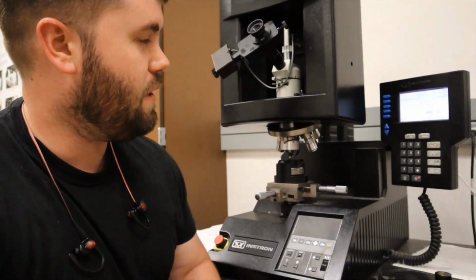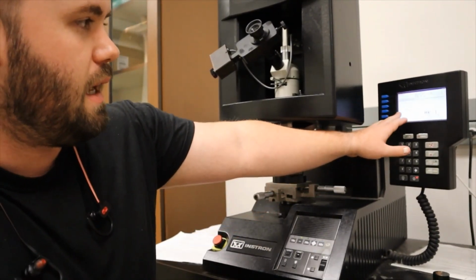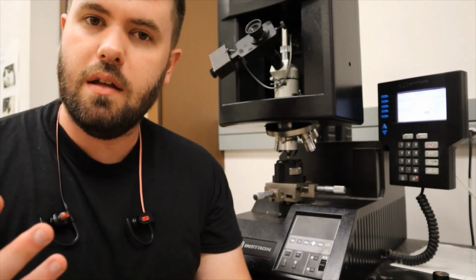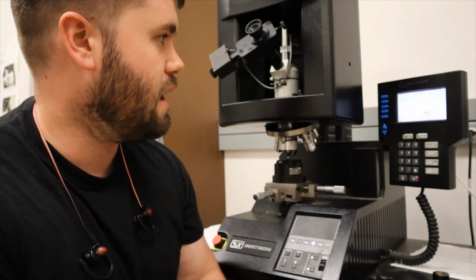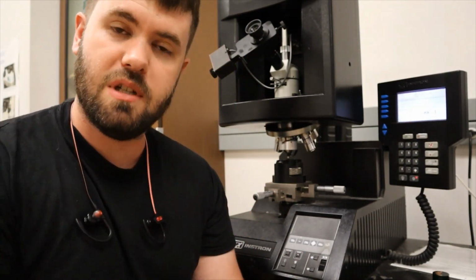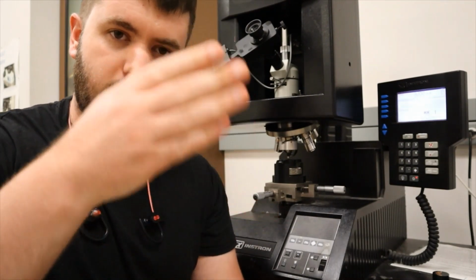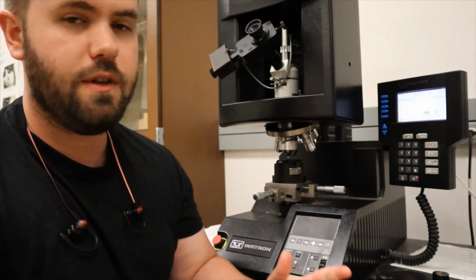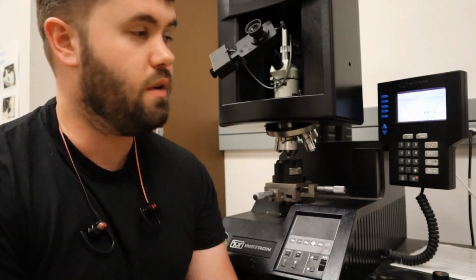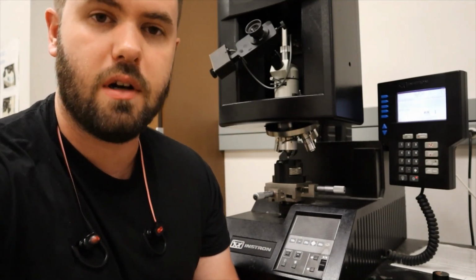So our test is completed. It's really quick. Now it is asking for a diagonal in microns. You might remember when we did the Vickers test previously, it asked for 2 diagonals, because with Vickers, because it is a uniform diamond shape, you take the horizontal and vertical diagonal of your diamond, whereas for the Knoop you only take the diagonal of the longest dimension of your indent. So it only needs 1 to calculate a Knoop hardness value.